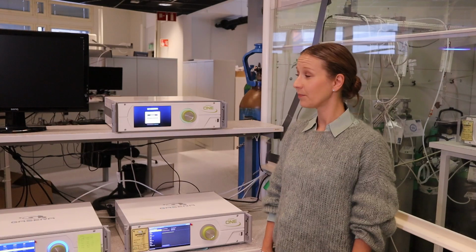Hello, I'm going to show you how to operate our GASERA 1. The device always does a self-test when the power is turned on. During that self-test, the device will check all the valves and communication between the cards. And now the device has already done the self-test sufficiently and the login menu appears in the UI.